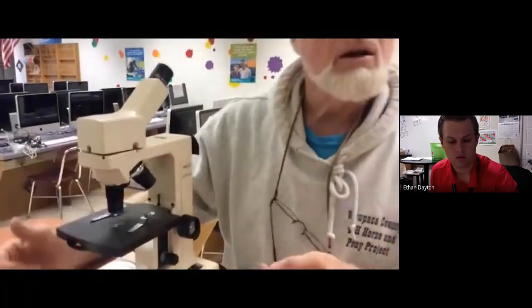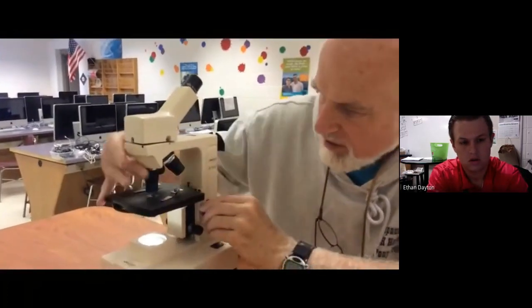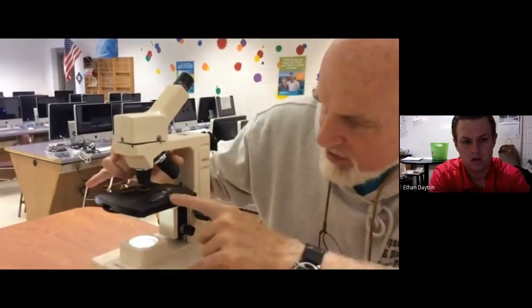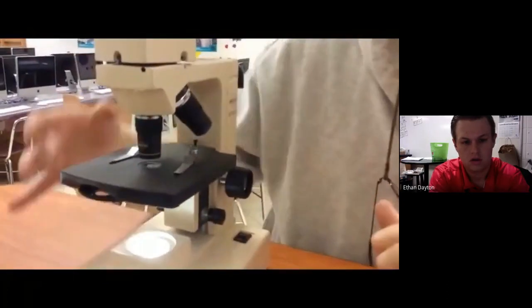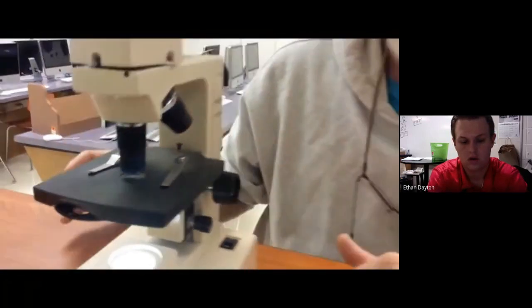So, Mr. Welsh, why would somebody want to have their nose down before they put it into high power? Good question. You want to have your nose down to the stage because when you have your glass slide in place, the stage would be up here when it's under focus, under low power, and you're up like this. And when you move into medium power, you can see the distance between the medium power and the slide that would be in place would be a lot less. And now when we move to high power, it's just barely above the glass. So we don't want the lens broken or the slide to be broken.